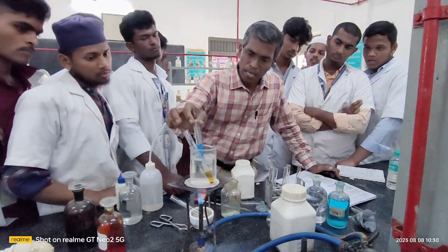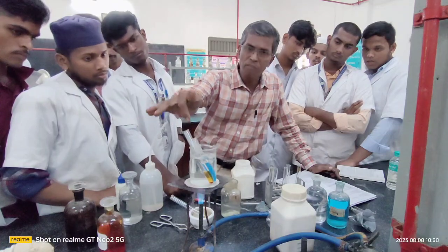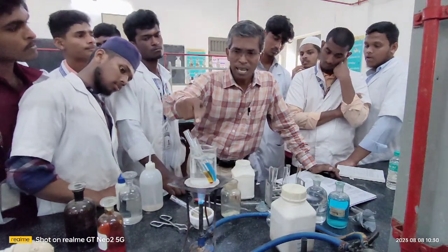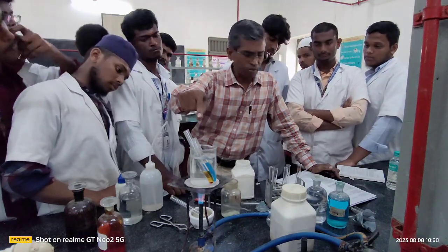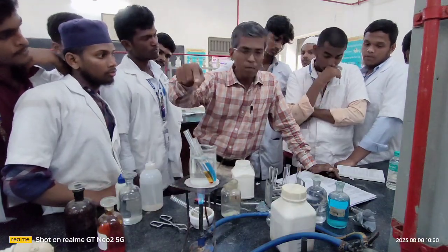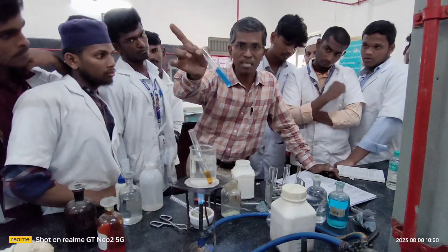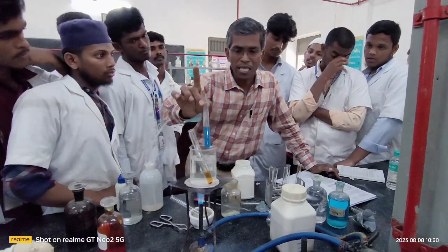Now I keep the second one also here. The first one we kept to confirm the formation of your silver mirror. With the help of that, we are going to confirm the presence of carbohydrate, and the second one also we are going to confirm the presence of carbohydrate. Once the carbohydrate is confirmed, we get a red brown precipitate. This mixture will turn into a red brown precipitate, which confirms the presence of your carbohydrate.